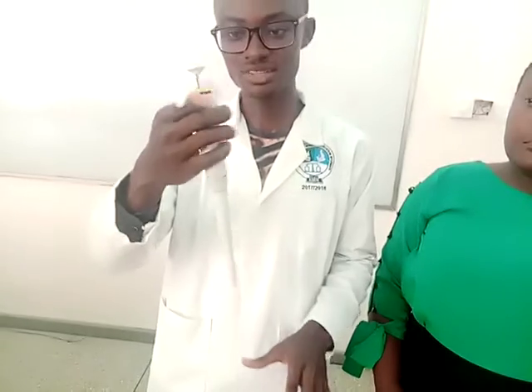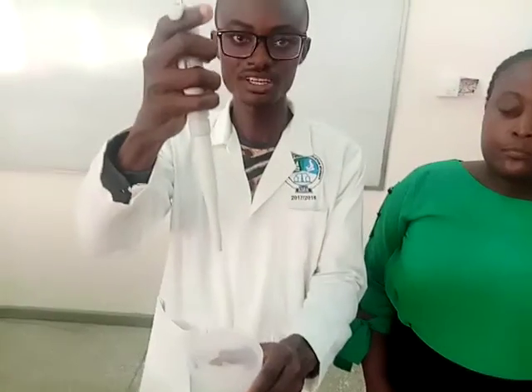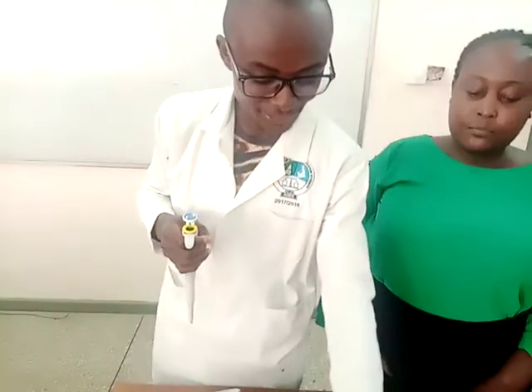After that, what I have to do is eject the tip. When ejecting the tip, you don't use your hand to remove the tip. What you have to do is use the tip ejector button over here. So you just press the tip ejector button over the empty beaker. So you press and eject the tip.